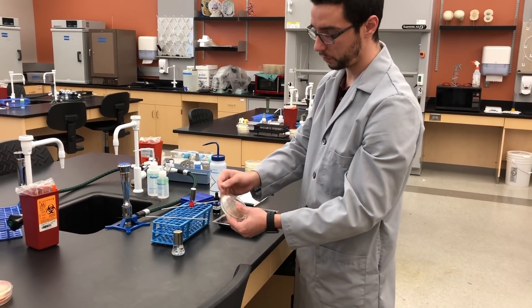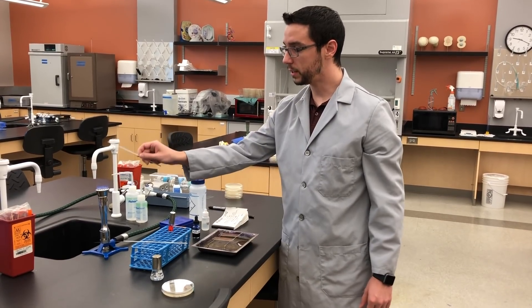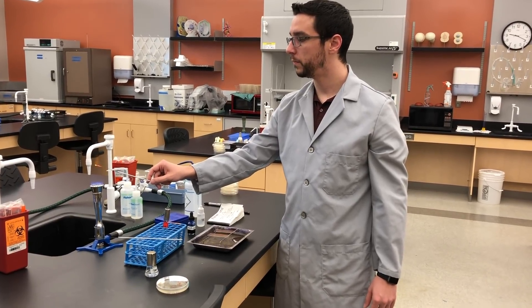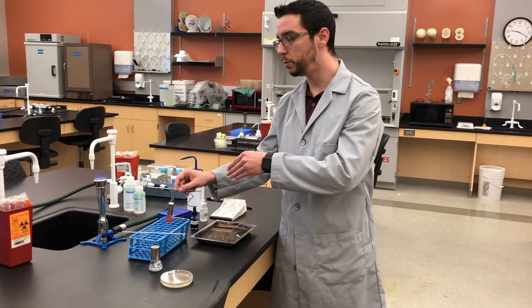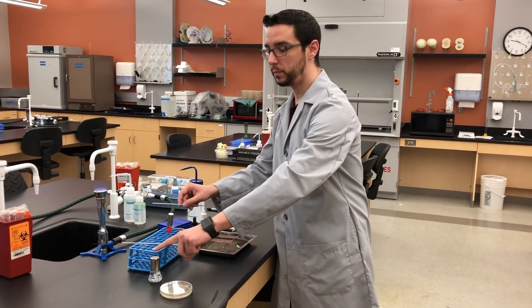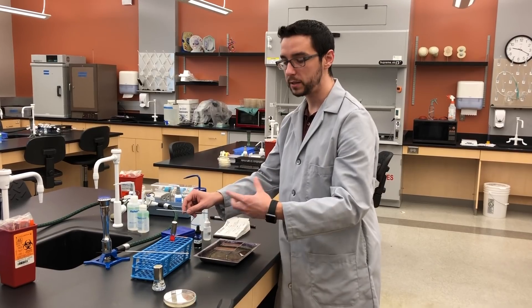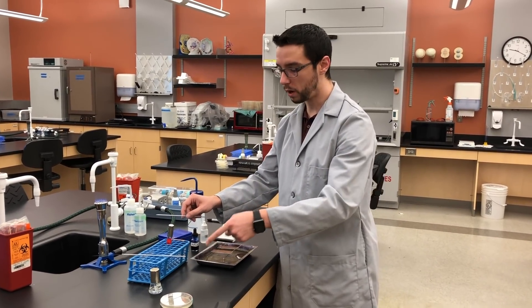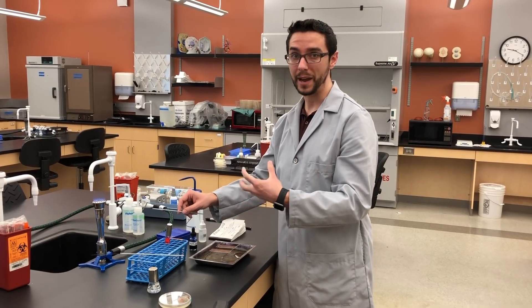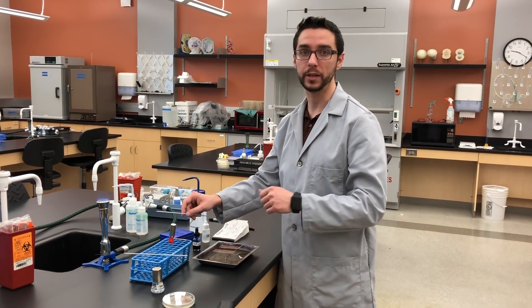I'm going to tape up the plate for good practice. This loop should still be sterile, but just in case — good practice is to always sterilize before you use it. Now we're going to use the loop to bring a culture from a broth onto the slide. Notice we're not going to bring sterile water onto the slide because this is already a liquid culture. The reason why we use water for the agar plate is because it's a solid culture, and even microscopically the bacteria will remain a giant clump. Adding it into water and mixing it around will dilute it out so we can actually see the individual bacteria.